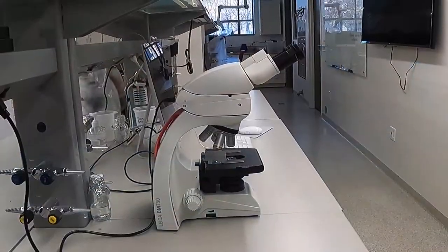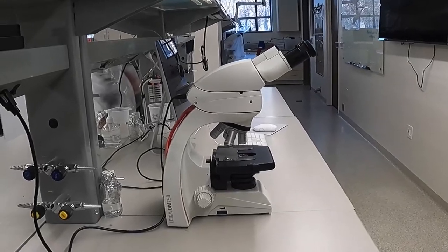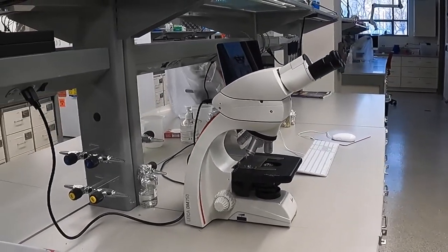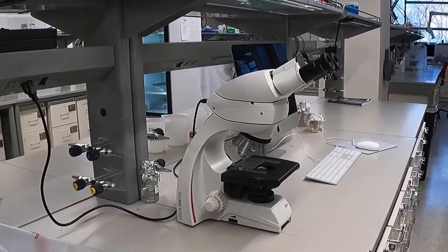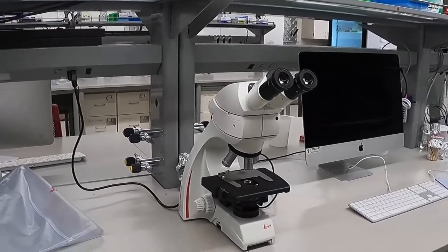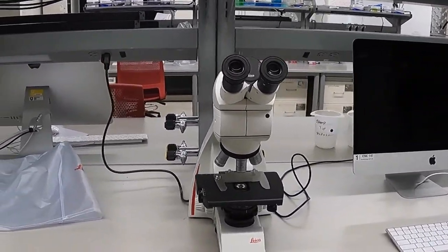Including the parts of the microscope, the procedure for finding and focusing on a sample, how to change the objectives, and how to leave the microscope at the end of the lab so that it is ready for the next user. We'll also go over some general rules to keep in mind and some basic troubleshooting.